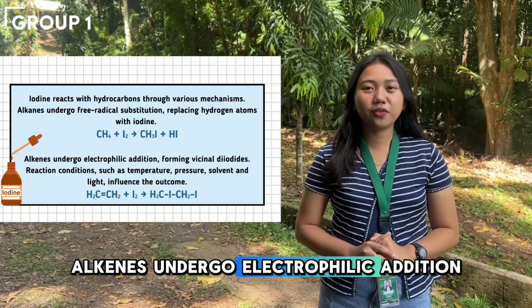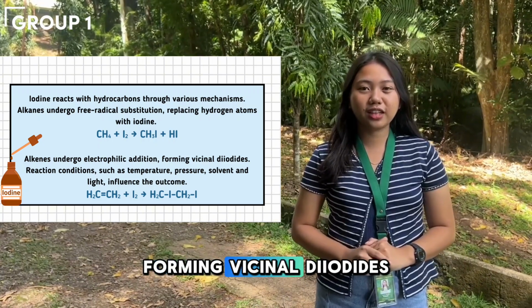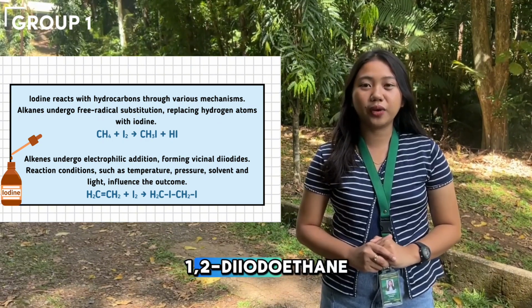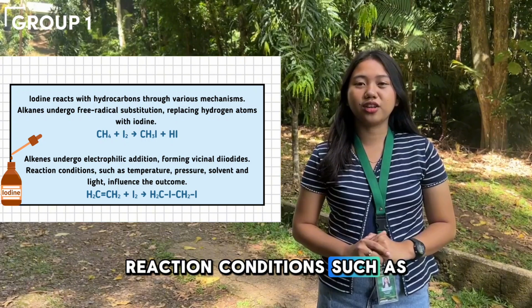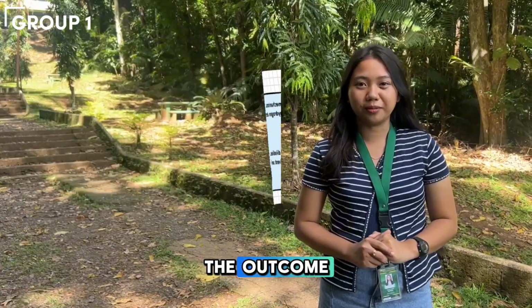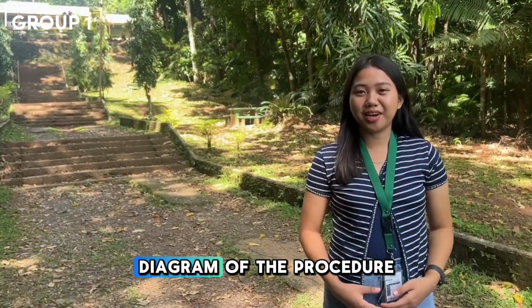Alkenes undergo electrophilic addition, forming vicinal diiodides. Ethene plus iodine produces 1,2-diiodoethane. Reaction conditions such as temperature, pressure, solvent, and light influence the outcome. Next is the schematic diagram of the procedure.